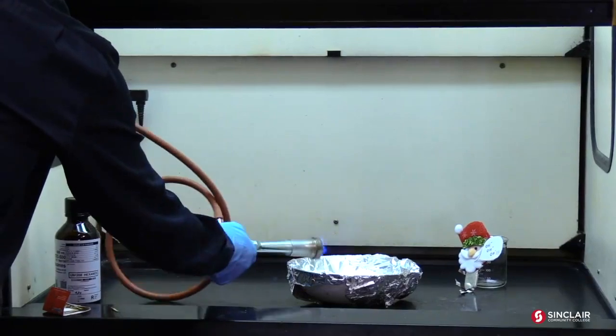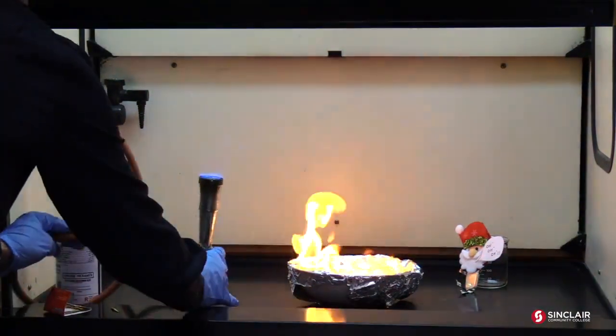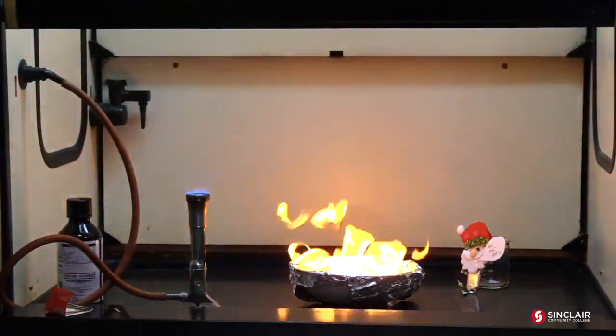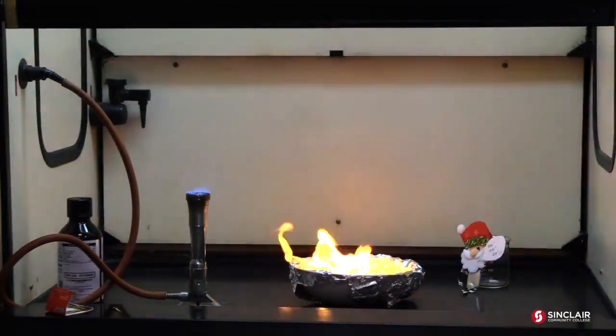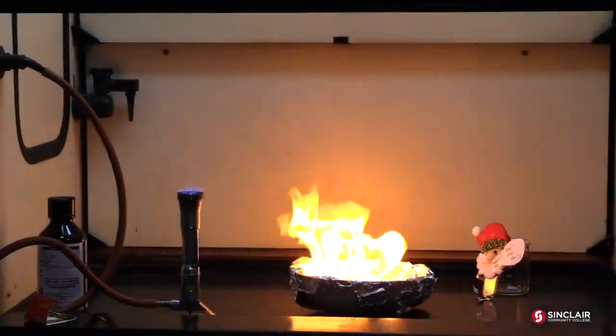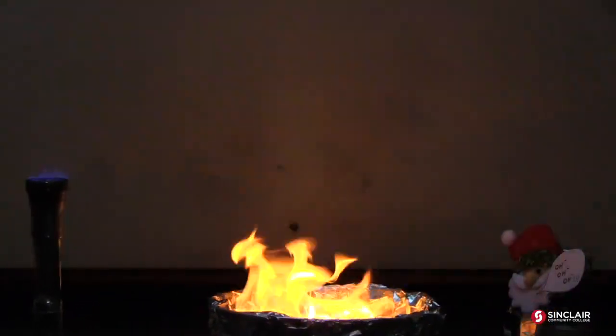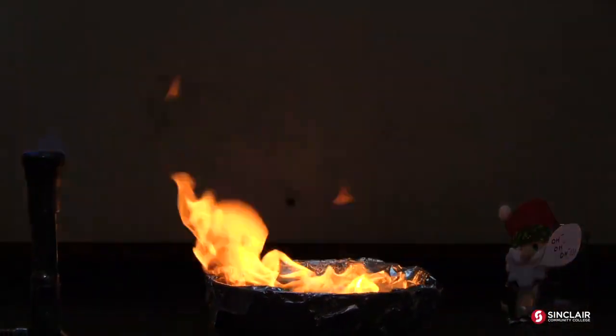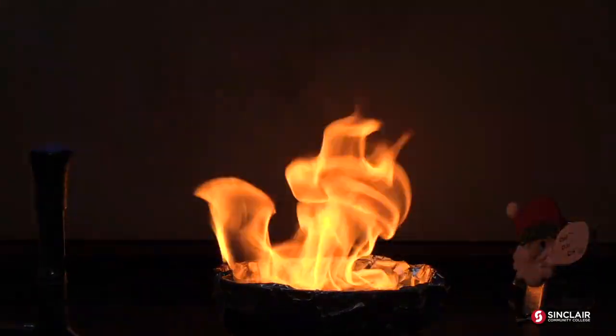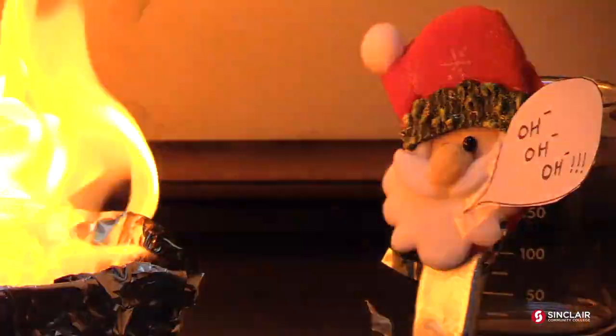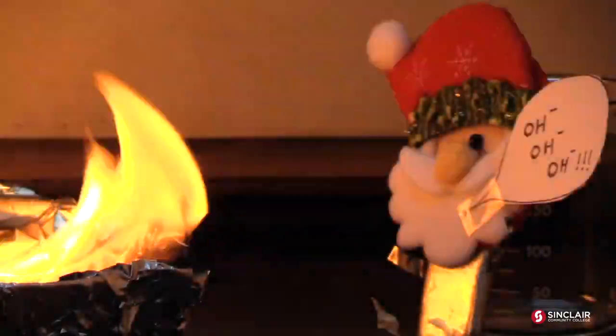Remember, this is saturated and generally, geez, that was a lot. You can see a little bit of carbon, but not too much. And that soot is, you know, probably the result of it not getting enough air. But, you know, that's generally a pretty clean flame. Oh, this is way hotter than the North Pole. Oh, Nelly.